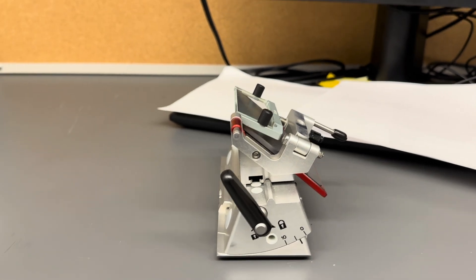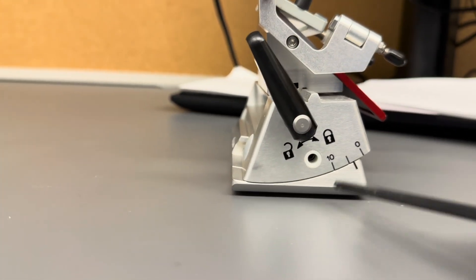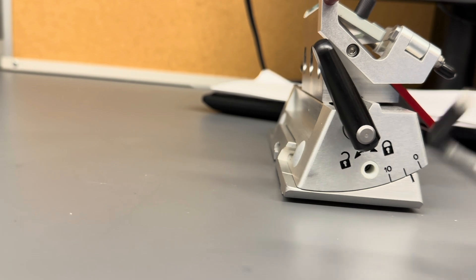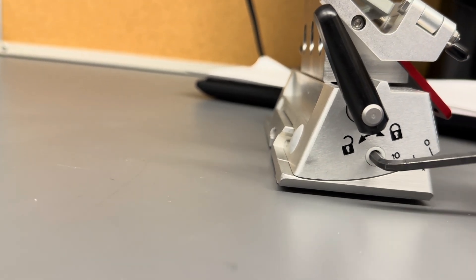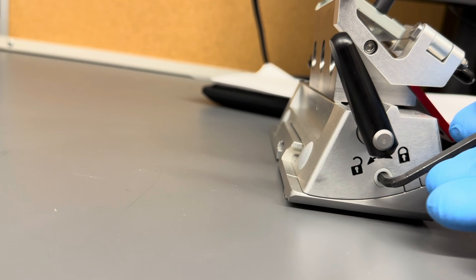What they replaced it with is in this hole right here. There is an Allen screw, and this is a four millimeter Allen screw. You can actually loosen or tighten the Allen screw.